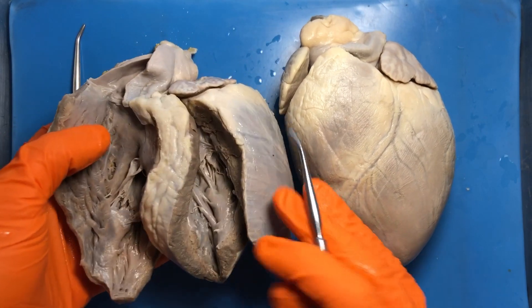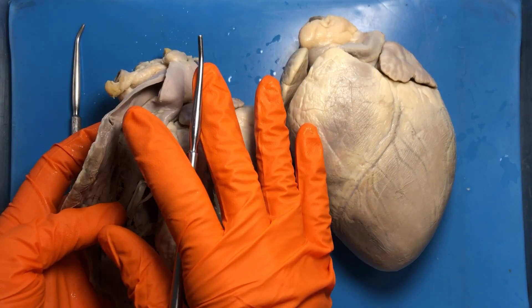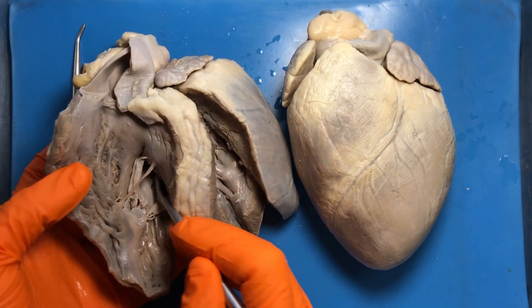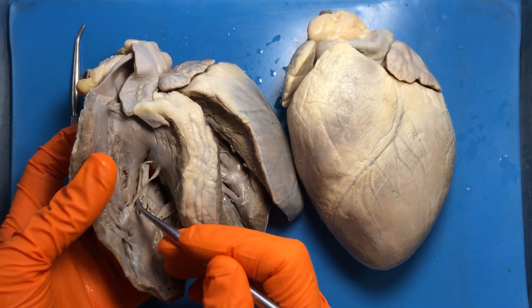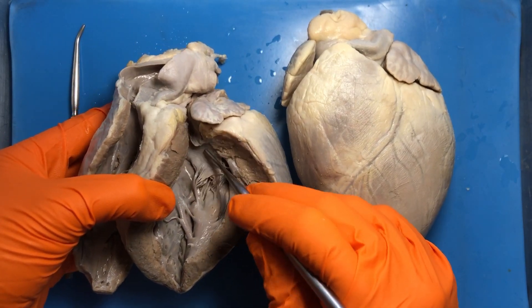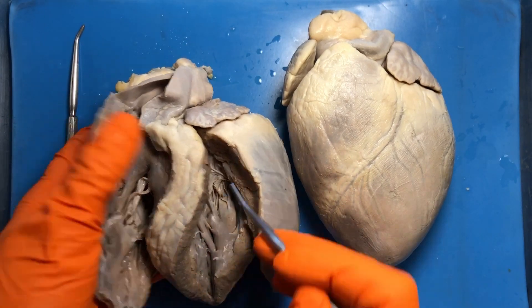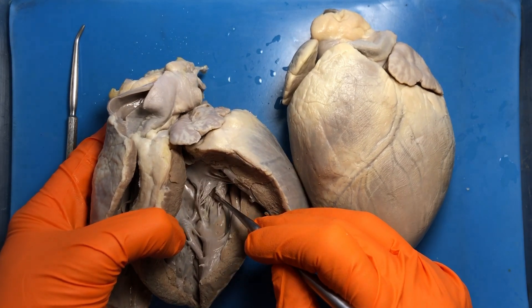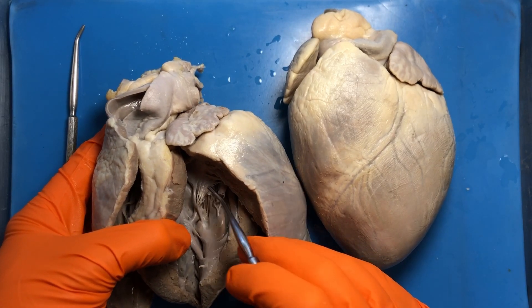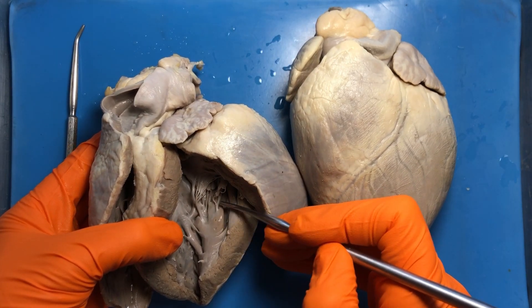The AV (atrioventricular) valves connect the atria to the ventricles. On the right side the AV valve is the tricuspid valve, and on the left side it is the bicuspid valve. The little strings you see attached to these valves are called tendinous cords, or chordae tendineae — that's where the saying 'pulling on my heartstrings' comes from — and those tendinous cords are attached to the papillary muscles.